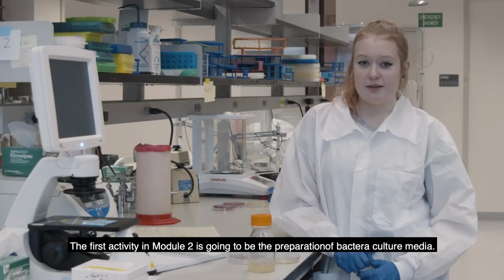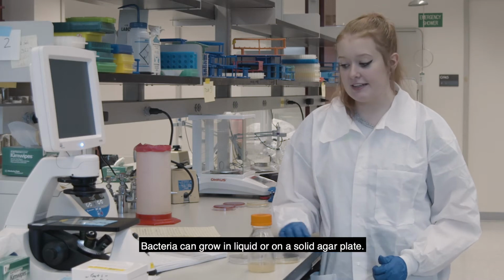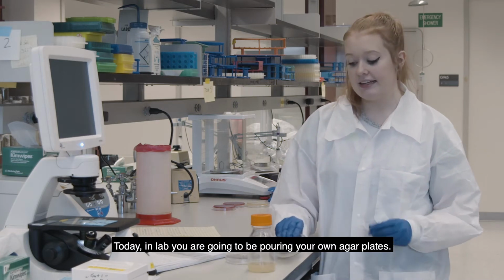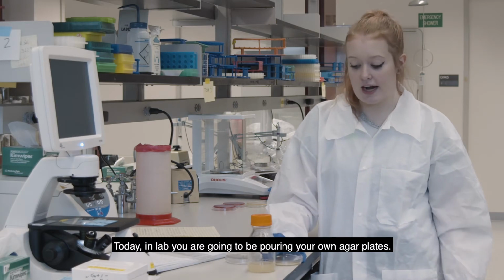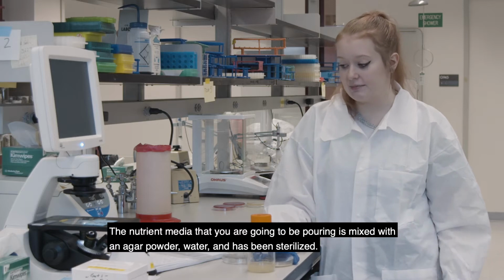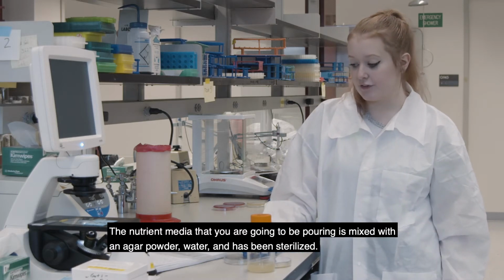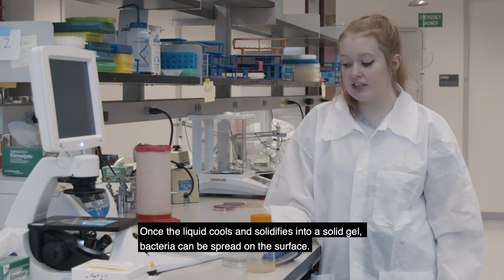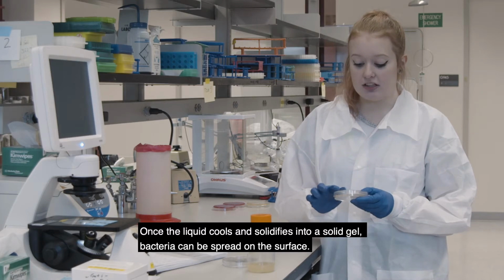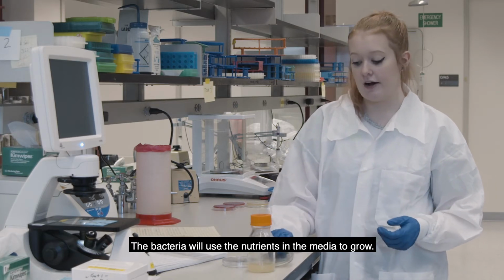The first activity in Module 2 is going to be the preparation of bacteria culture media. So bacteria can grow in liquid or on a solid agar plate, and today in lab you're going to be pouring your own agar plates. So the nutrient media that you're going to be pouring is mixed with an agar powder and water and then has been sterilized for you. Once the liquid cools and solidifies into a solid gel, bacteria can be spread on the surface, and then the bacteria will use the nutrients in the media to grow.